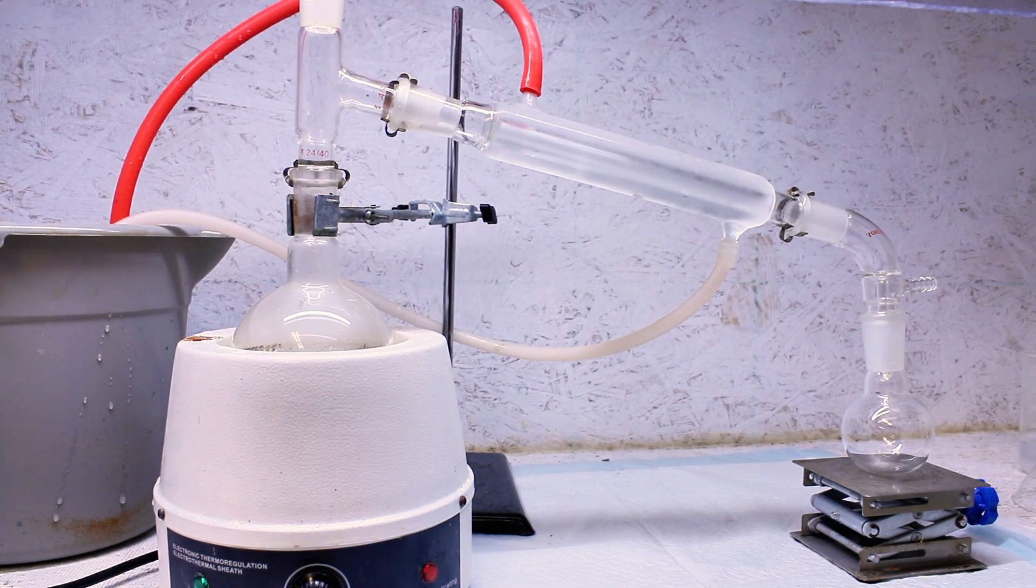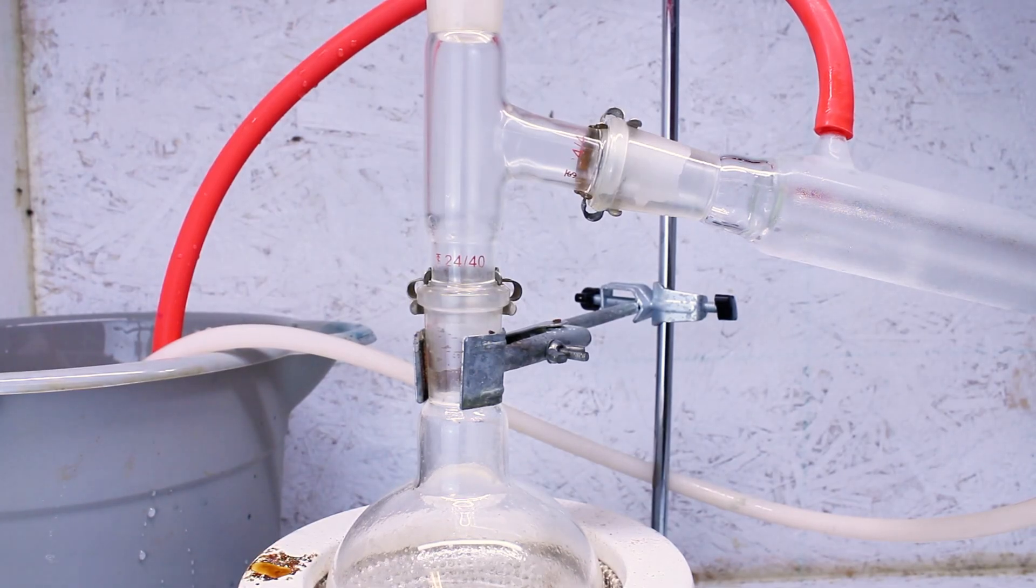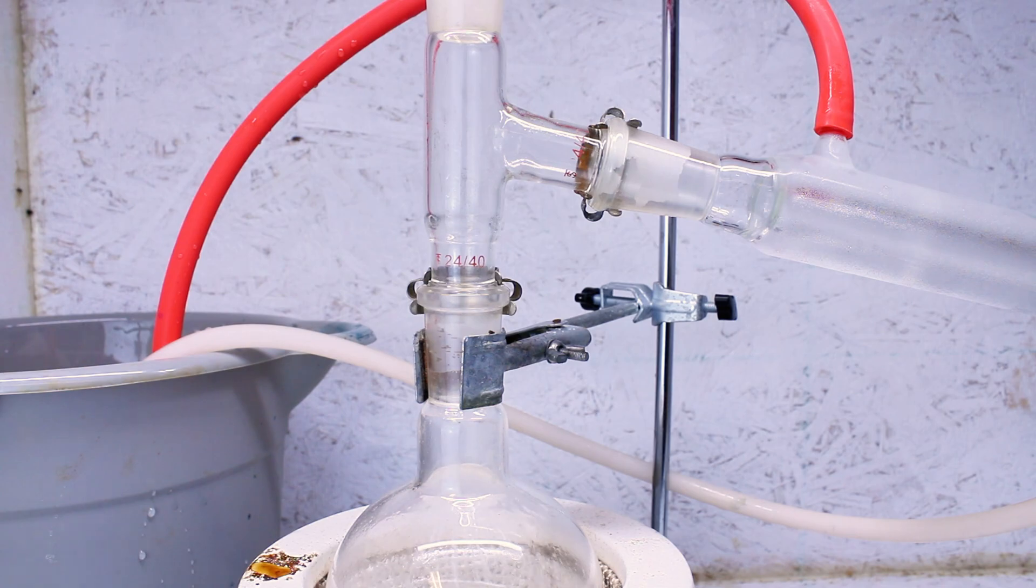Regardless though, I don't even really think it's necessary as I've done this again since filming this video, and virtually all of the distillate comes over in this range anyway. That said, using the thermometer is proper lab technique for something like this, but it doesn't really seem necessary for this particular project.